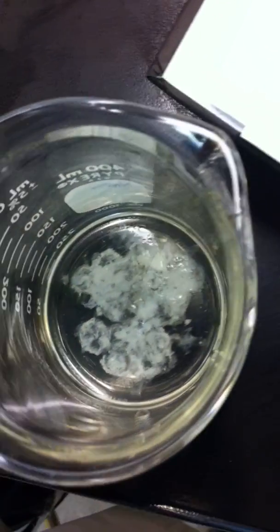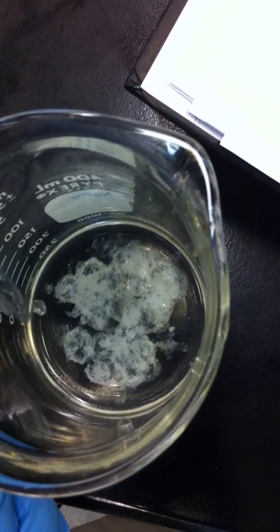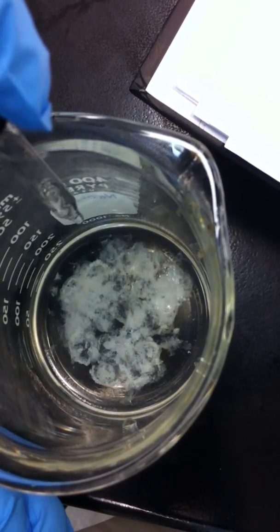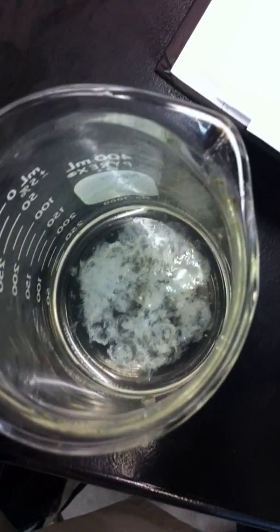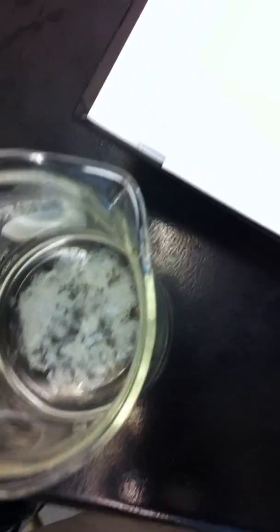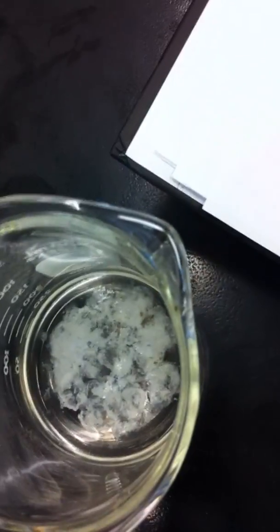It's like you're creating... I'm not even going to say it. Oh my god. Oh, I should probably stir this, right? No, it's good. No? You don't stir it? I'm pretty sure you had to stir. That's good. You're doing good.